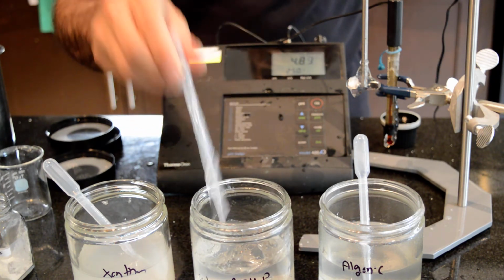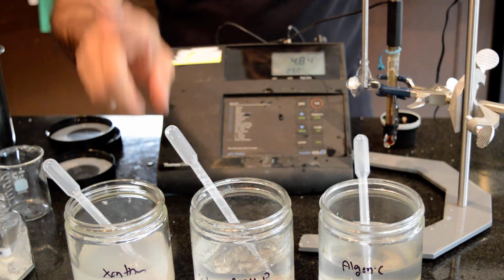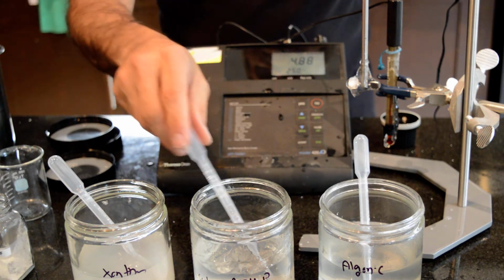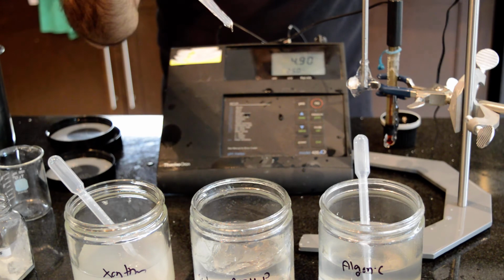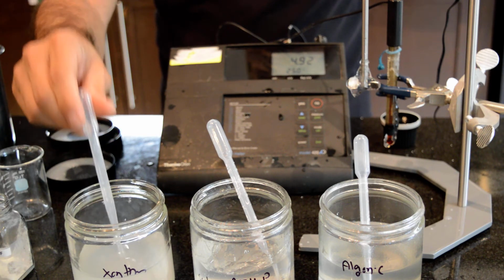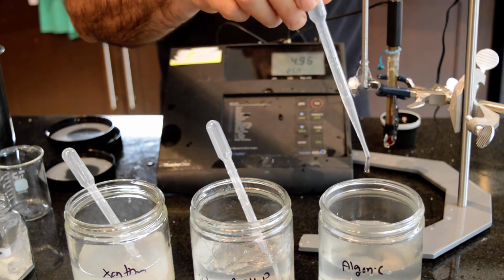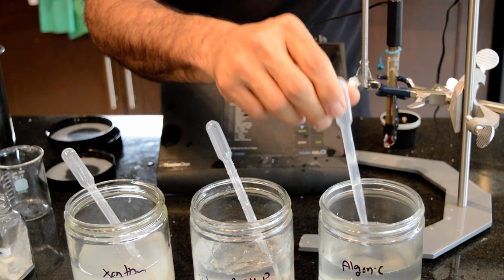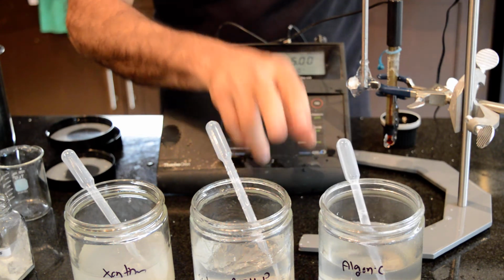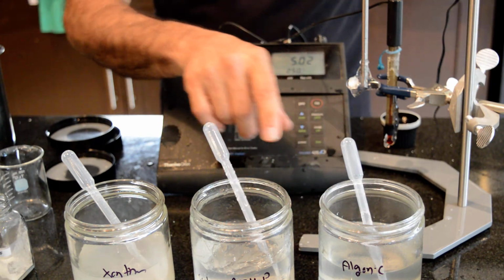And keep in mind, the concentrations of these three gelling agents are exactly the same. Let's say if I put 1 gram here, I put 1 gram there, 1 gram there. So if you want to make a thick gel with high viscosity, for sure you want to use carbomer. If you want to use something which is food grade and safe, definitely you need to use xanthan gum. And alginic acid, I don't know what to say. This stuff is not even a gel. I do recall that alginic acid is usually used in combination with the other two gelling agents. So you see a combination of alginic acid and xanthan gum, or alginic acid and carbomer.